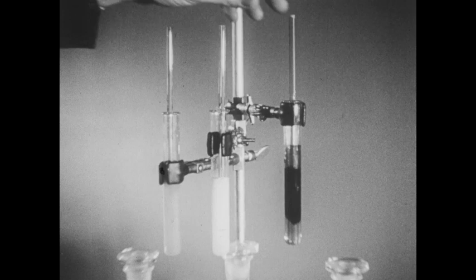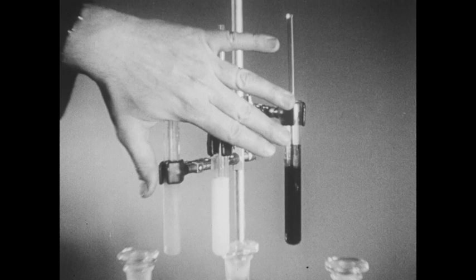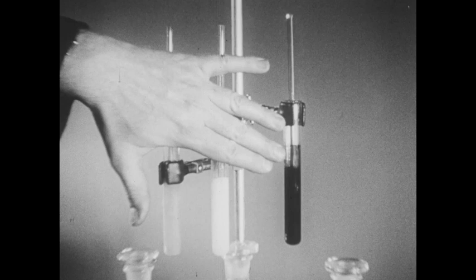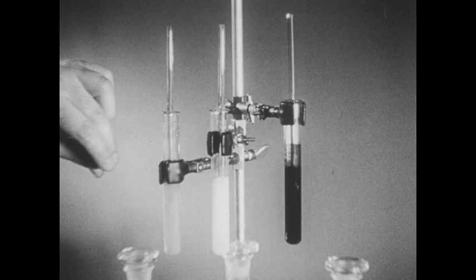And instantly, the characteristic black color of nickel sulfide appears. When we have enough sulfide ions — as we do in ammonium sulfide solution — nickel sulfide is caused to precipitate. But remember that nickel sulfide did not precipitate with hydrogen sulfide water because an inadequate number of sulfide ions was present. This experiment tells us that nickel sulfide is more soluble than cadmium and zinc, but we can't tell from this experiment which of those two sulfides is the less soluble.